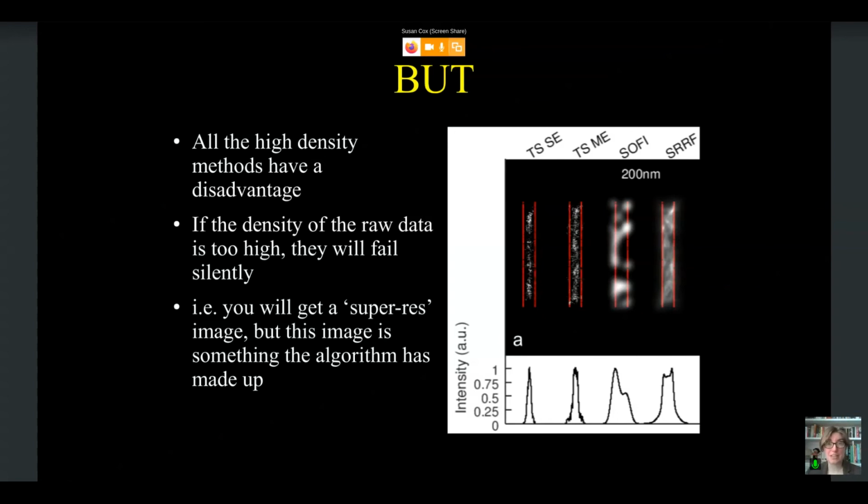And I show here an example where I have fitting of a high density data set where I have two lines that are separated by 200 nanometers. You'll note 200 nanometers is actually basically at the resolution limit. So we should definitely be able to see this if we're getting any degree of super resolution. But here I've done fitting of this high density data set with ThunderSTORM single emitter, ThunderSTORM multi-emitter, SOFI, and SRRF. But I want to emphasize I'm not picking these methods out in particular. I just used those because they were popular examples in their respective areas. It absolutely happens with the other methods that we've tested. It just might happen at a different density.